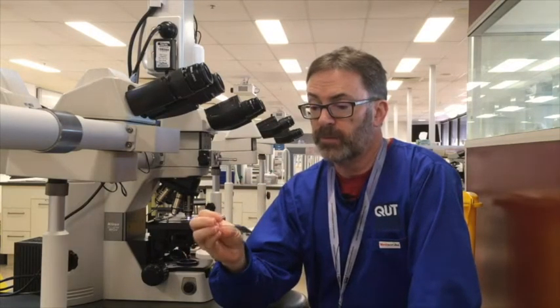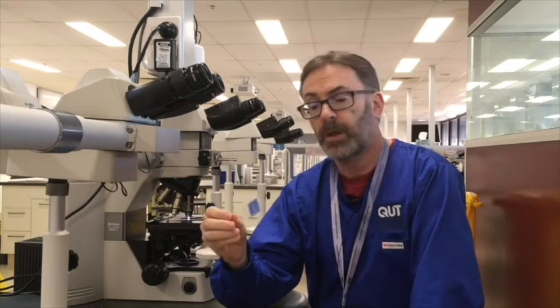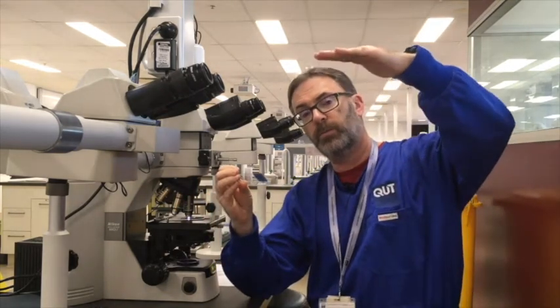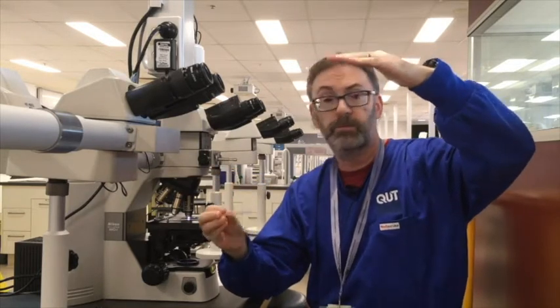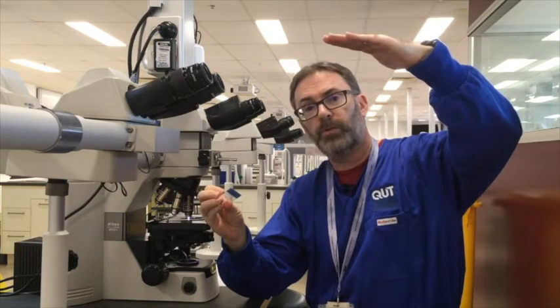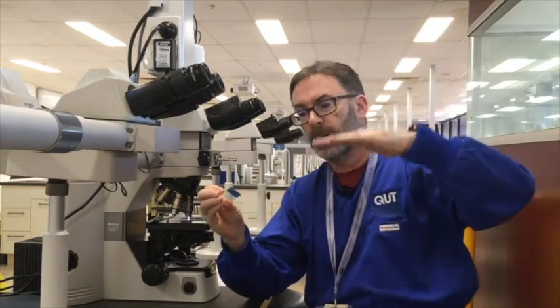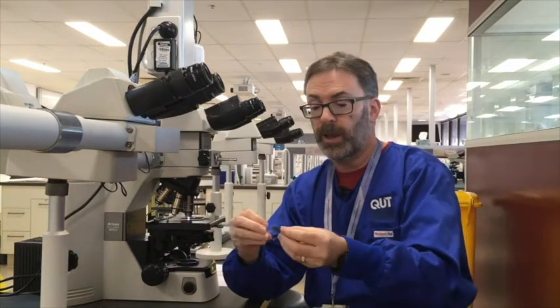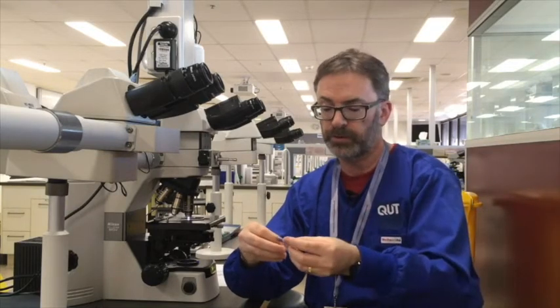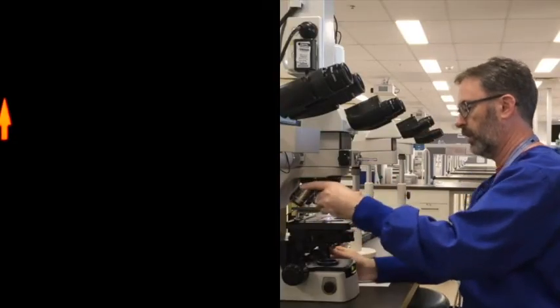Ehrlich's is a type of hematoxylin recipe that we refer to as being a regressive hematoxylin. By that, what we actually mean is that you'll originally stain the section for more than is required to demonstrate cell nuclei or other features, and then you will treat the slide with dilute acid alcohol in order to regress the level of hematoxylin back to the level that is optimal. And in the process, you're removing the hematoxylin from non-target background structures.